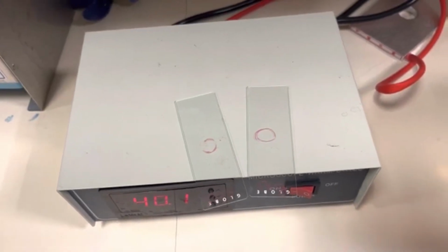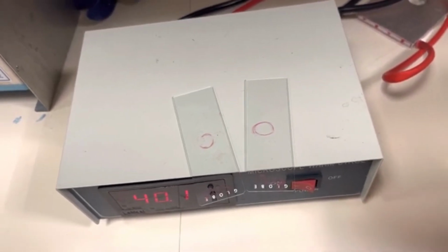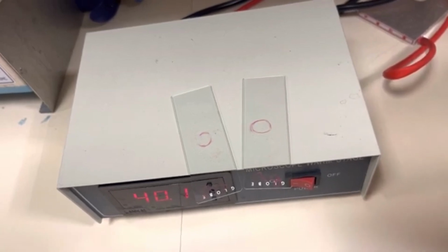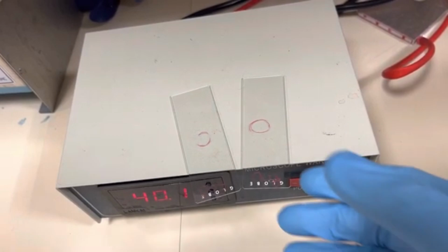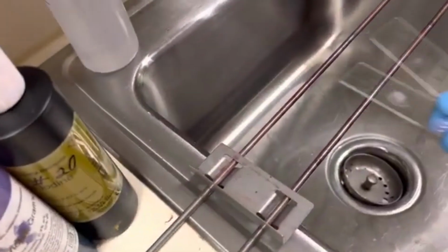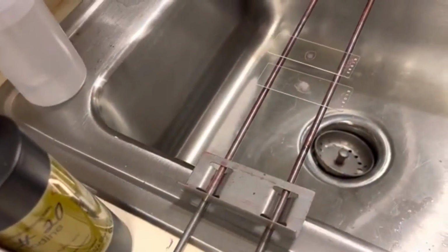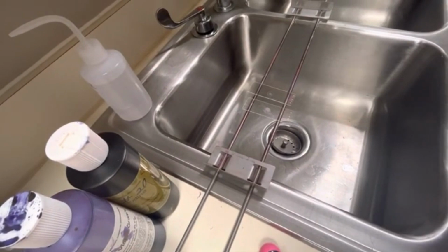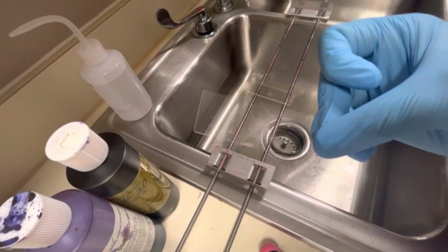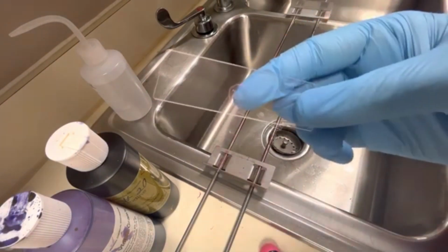Okay, so I've let those gram stain slides evaporate the liquid and then put them on a heat block. Actually for quite a while, I kind of stepped away and forgot about them, but they are here nevertheless. So what I'm going to do is transfer these over to a designated gram staining sink. Okay, so I have these completely dried, and you can see there's dried material in between the contents of that circle.